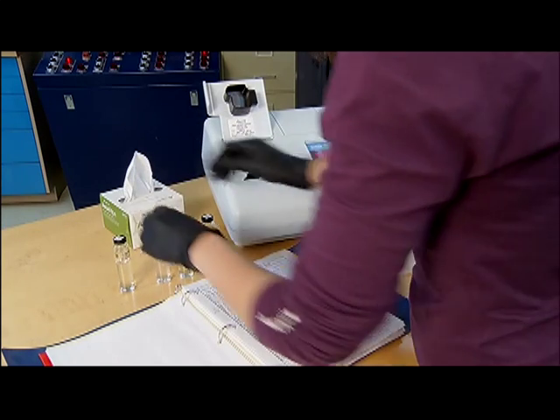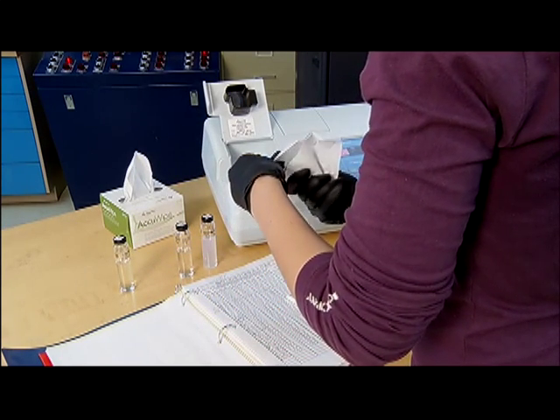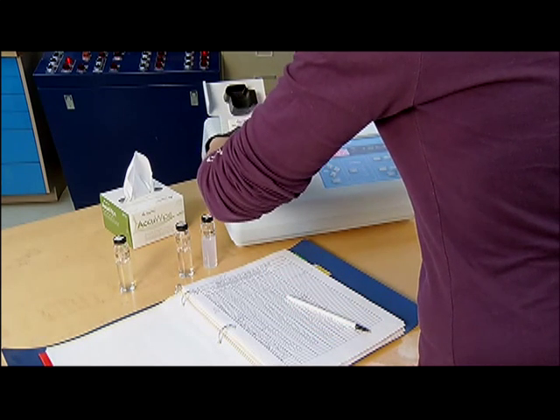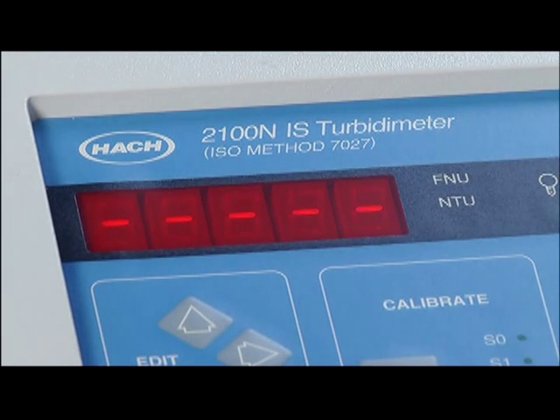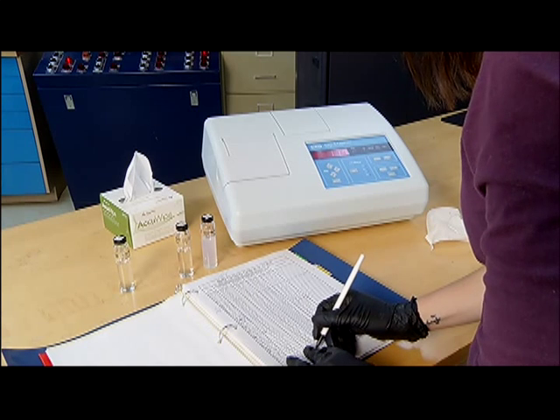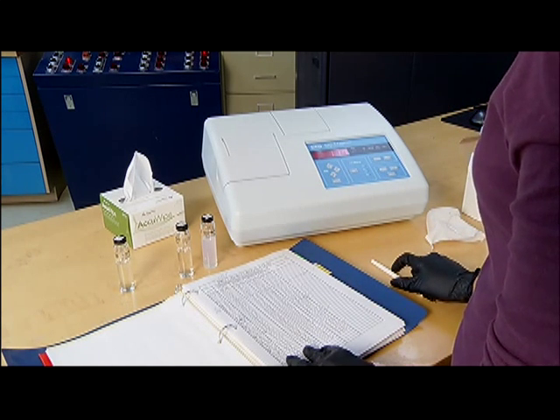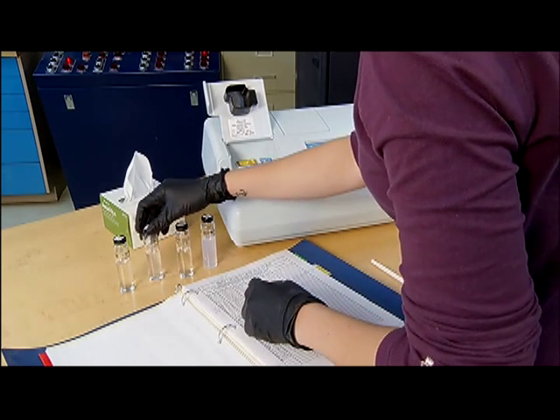The first standard solution is removed. The second standard solution is wiped and inserted into the instrument, and the reading recorded in the log manual. The process is completed for the third standard solution and repeated a fourth time in this illustration.